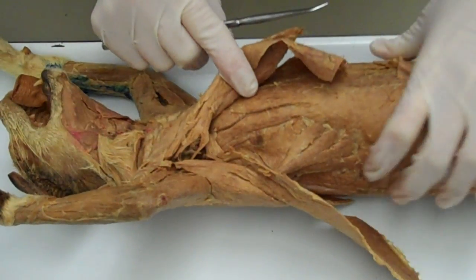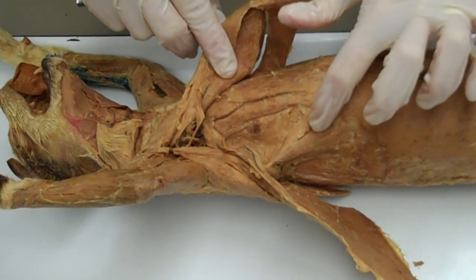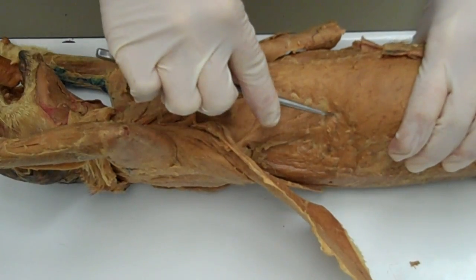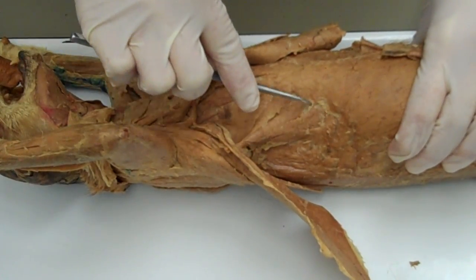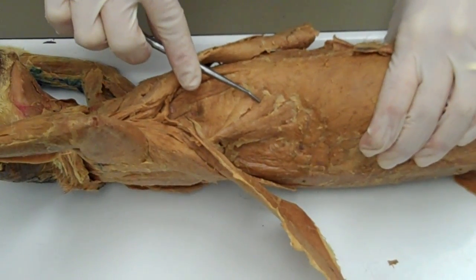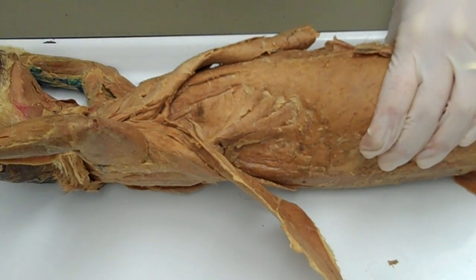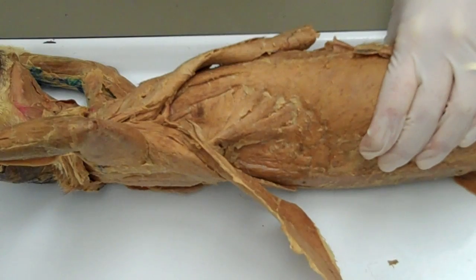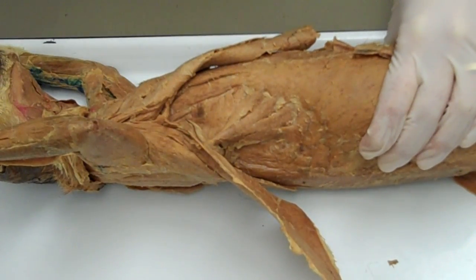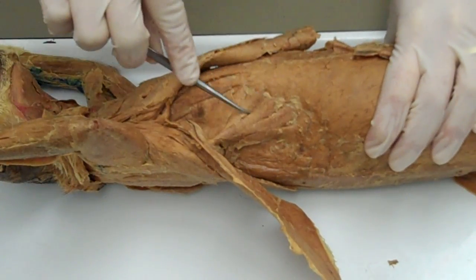The muscle on the lateral side of the cat that I want to point out is this scalloped muscle. It has a scalloped appearance because it's coming off of the ribs — this is the serratus anterior. The serratus anterior has its origin on ribs 1 through 8. It inserts on the anterior aspect of the medial or vertebral border of the scapula. Its action is to protract and rotate the scapula superiorly and laterally. It is also known as the boxer's muscle.